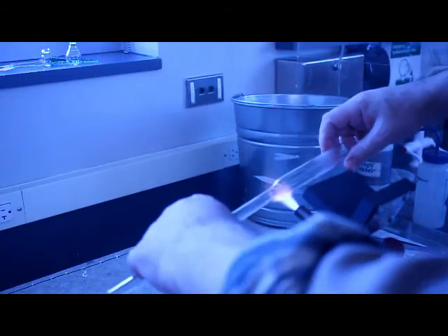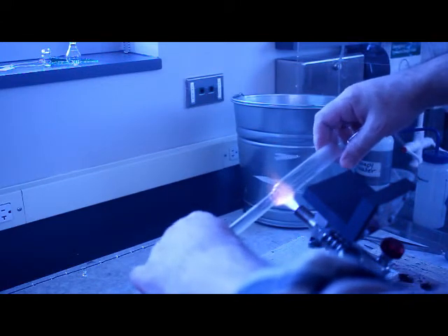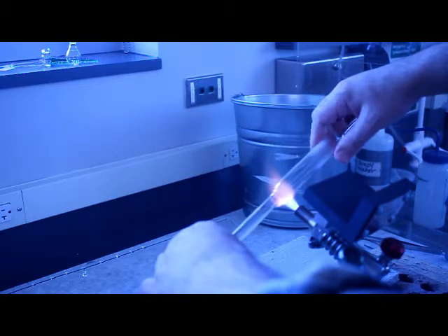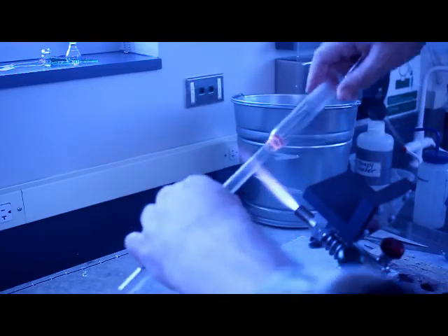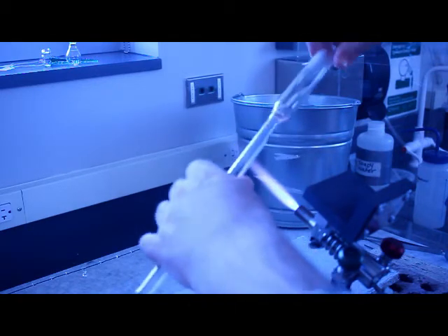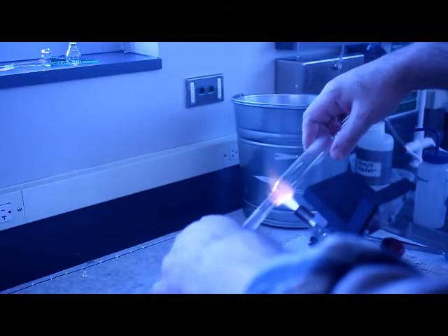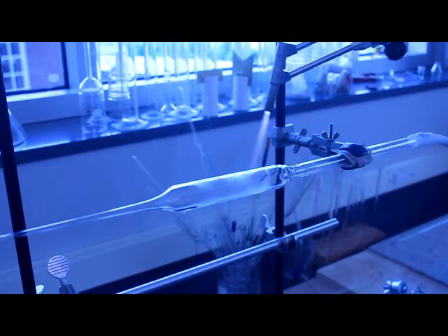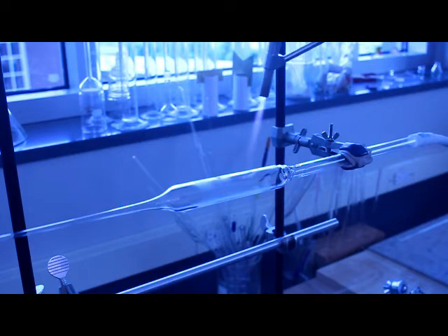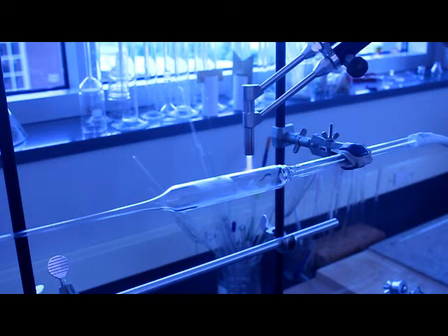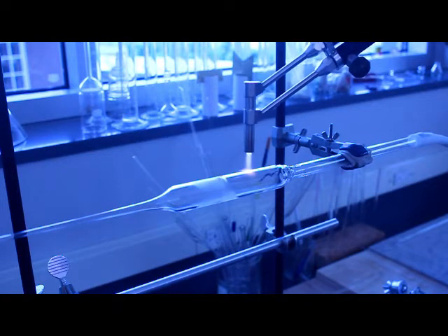Now if you notice what you're looking at right now is a repeat of a previous scene but I've zoomed and cropped onto the torch so you can see the glass fusing together. I will do that several times throughout this video because sometimes when you're watching a glass blowing video it's difficult to see what is happening right at the torch, especially if you have two pieces of glass about to be joined together. I'm going to be looking at the future to make better videos where I've got different perspectives, possibly more than one camera so you can see what's going on.